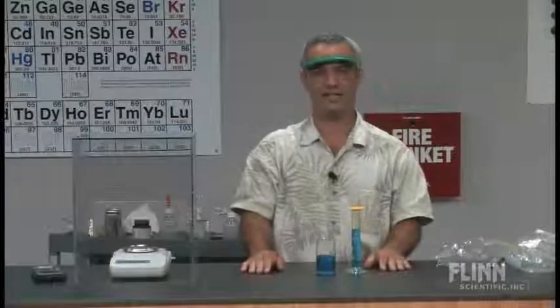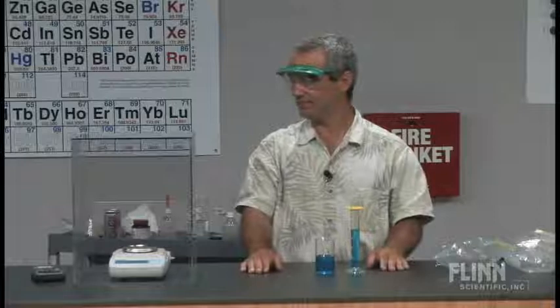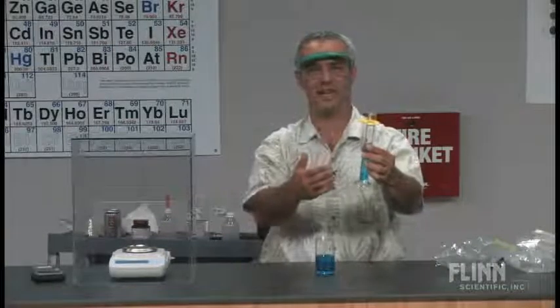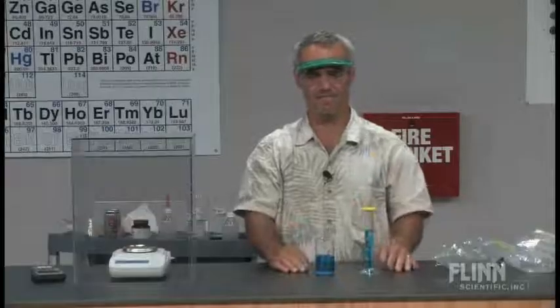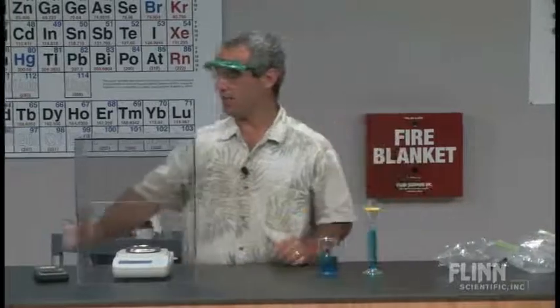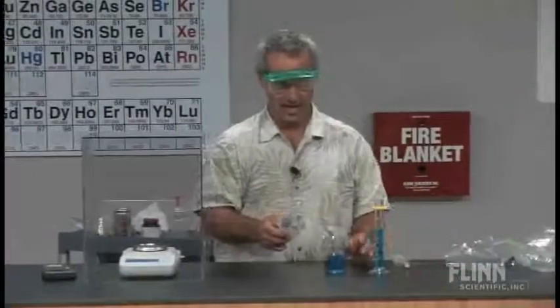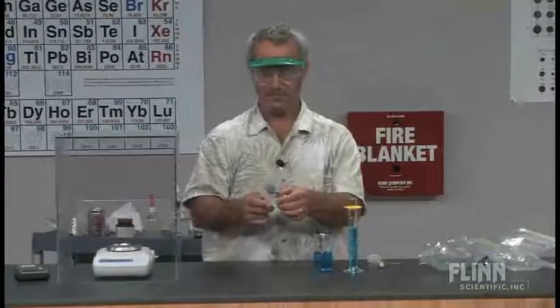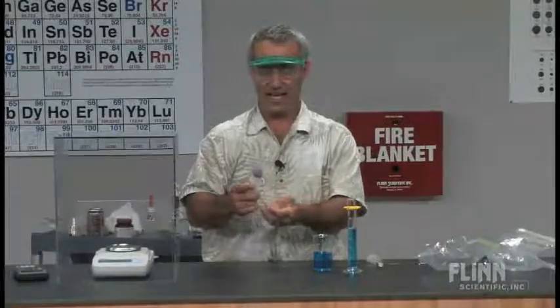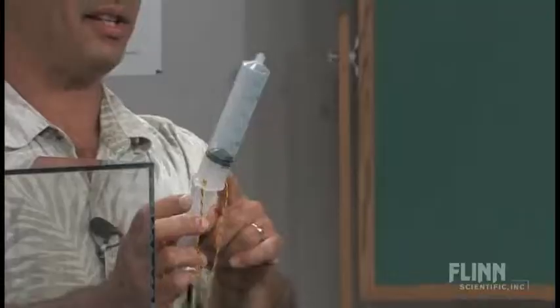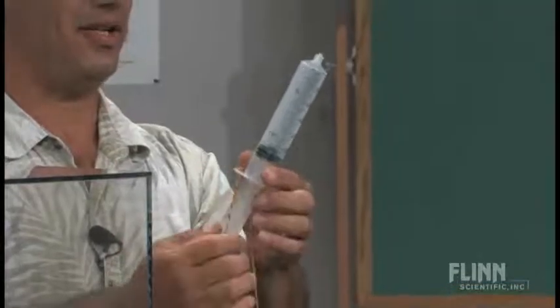But how would you find the density of a gas? I couldn't do the same thing here, it's already filled with gas air beforehand. So I'm going to show you this neat little technique involving syringes. I've got a 60 milliliter syringe, plastic syringe.